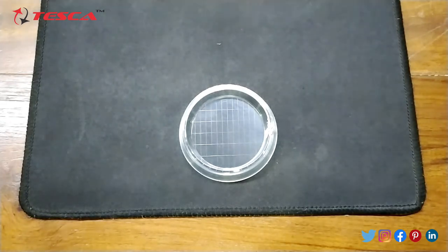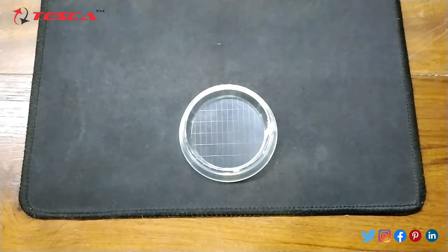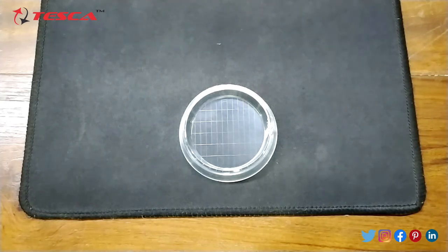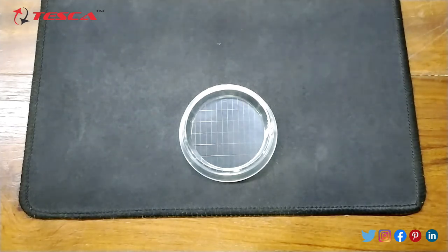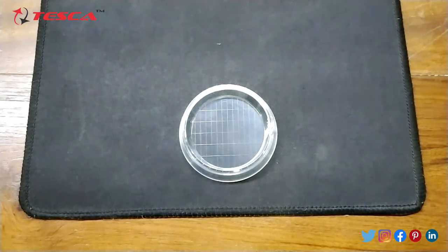It fits a 40 times magnification under the dissecting microscope. So this is the structural specification of the nematode counting dish. That's all the demonstration from my side.